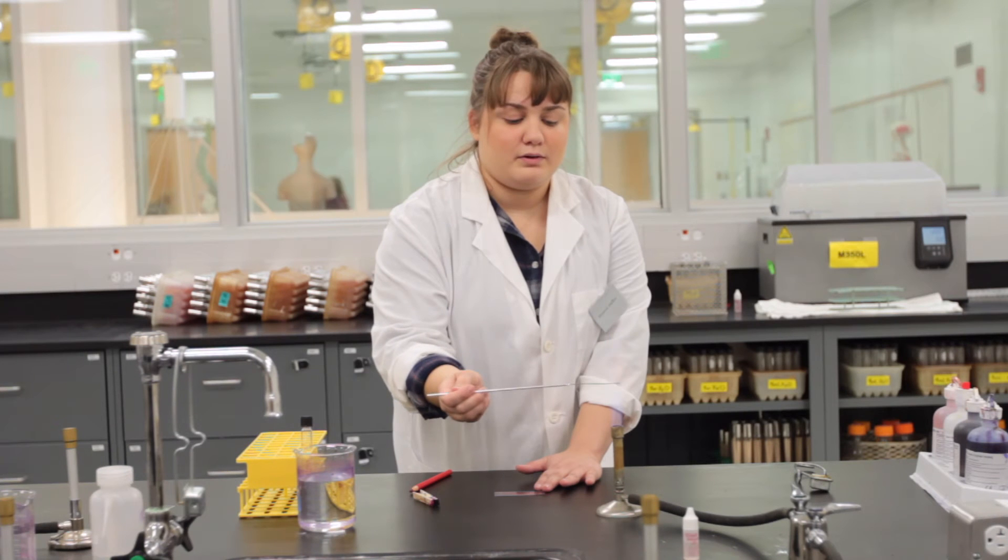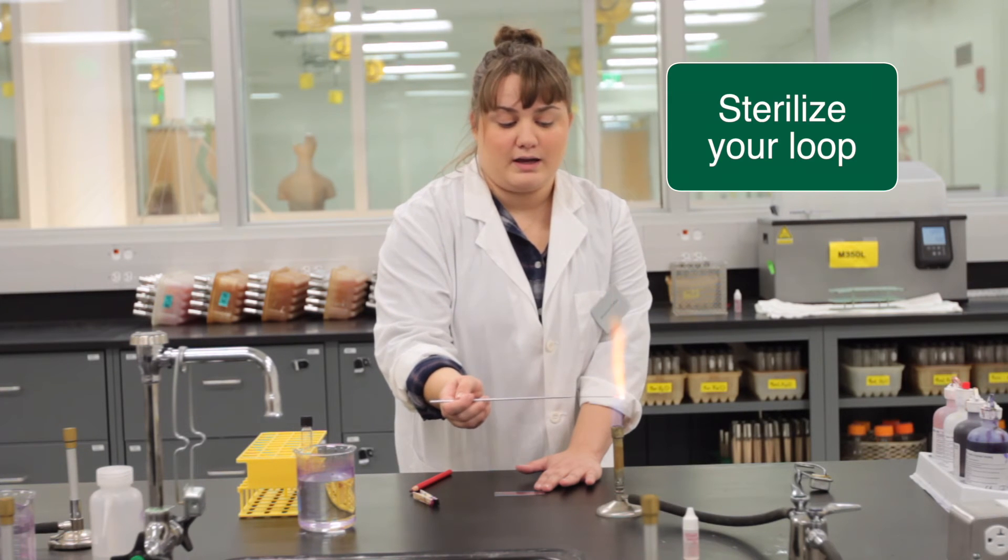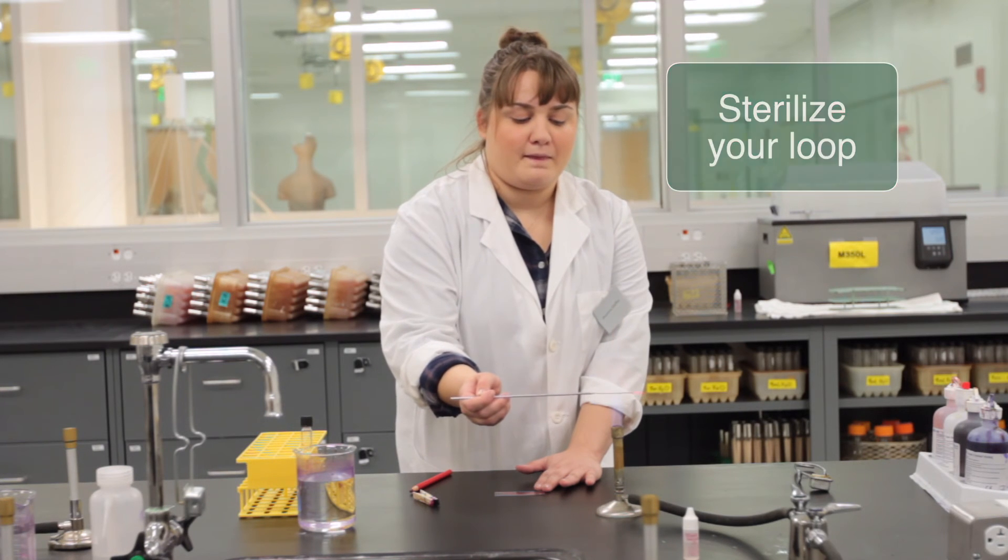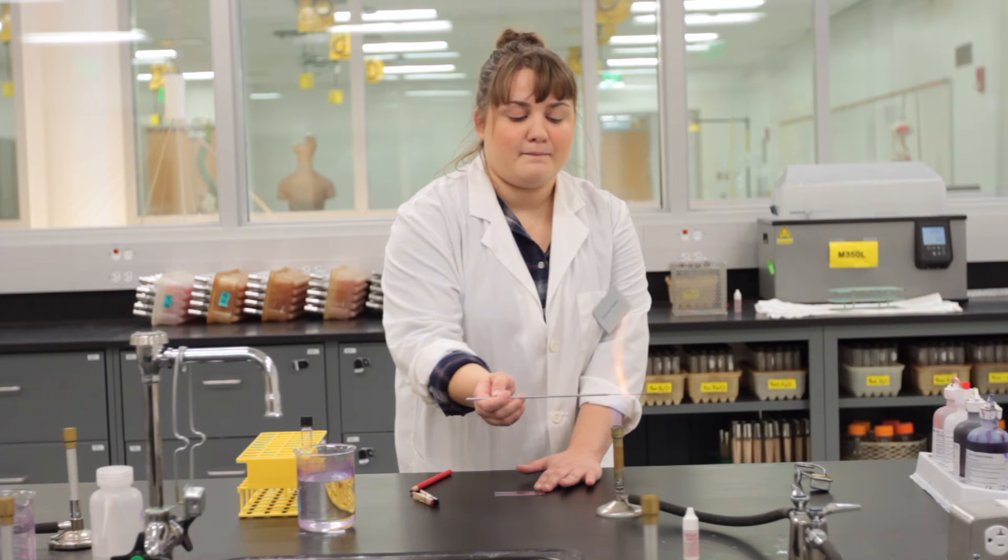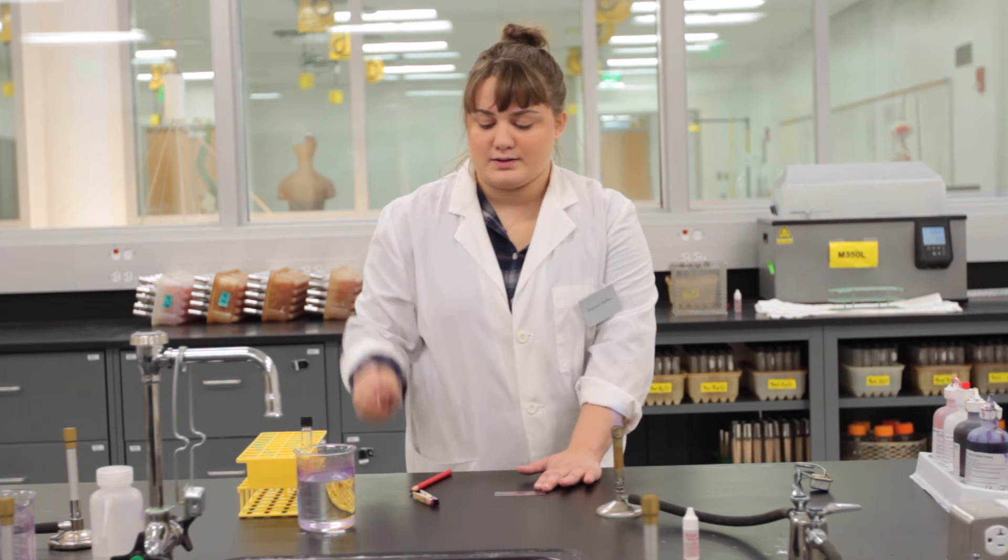Then you will take your loop and sterilize it again. And we are done with the loop.